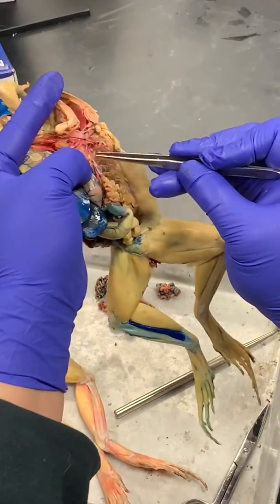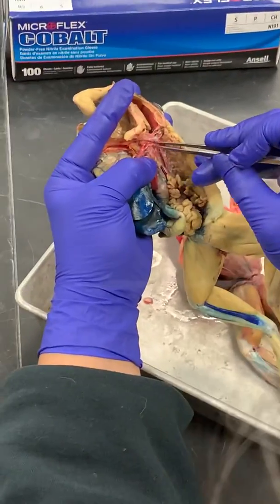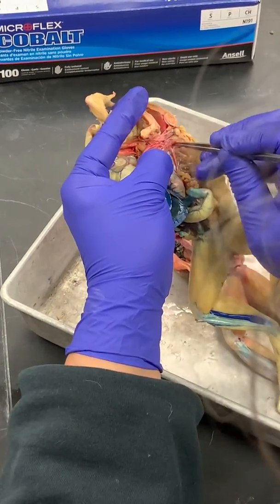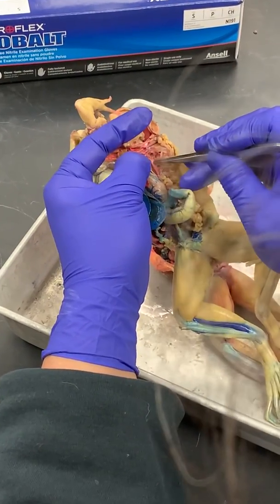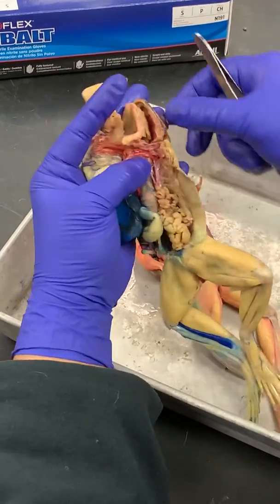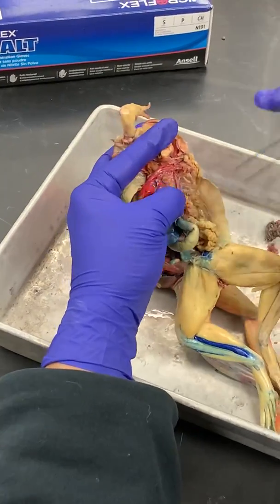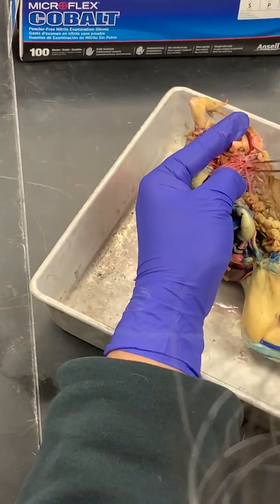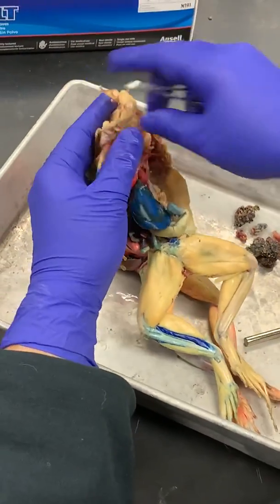And one thing I forgot to show you is that when we have our systemic arch right here in the middle, it turns down this way. But if we kind of peel some of this back, we can see there's like a huge branch that's going into the arm, which is over here. It goes off into the arm. You can see here's a big tributary here, and then the part that goes to the arm is cut off because the arm's over here.